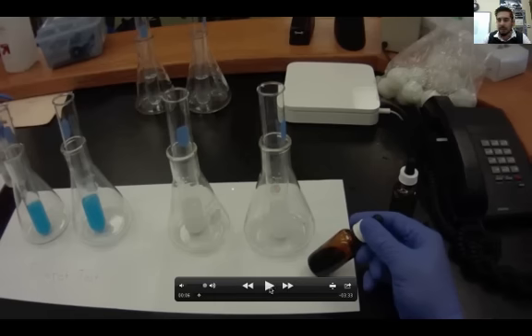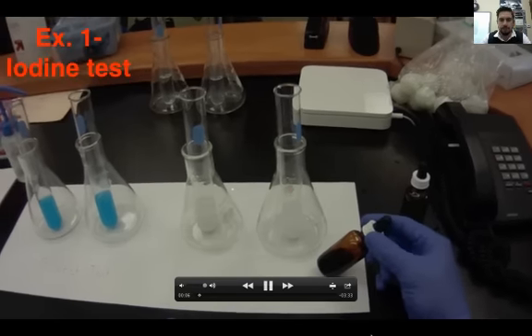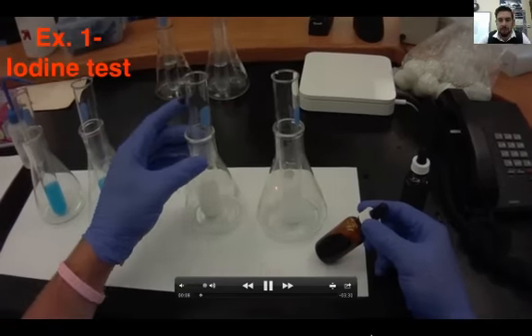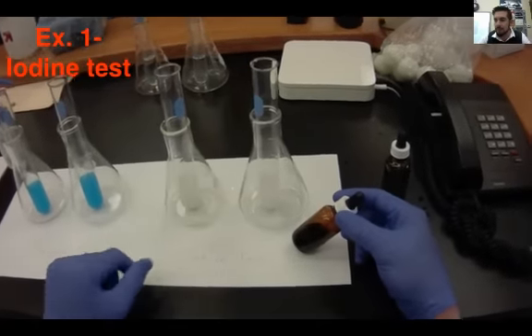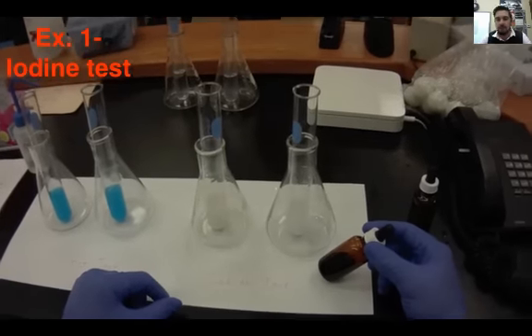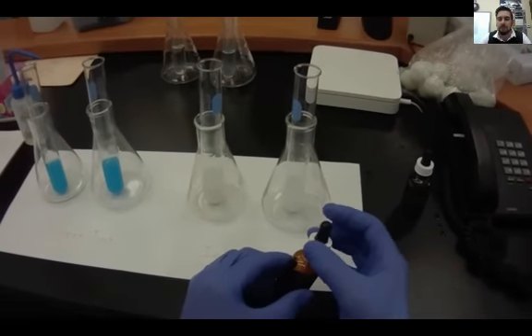You can see right here that I have my iodine ready to go. In these two tubes I have an unknown sample of either a polysaccharide or a monosaccharide or a protein. Well, the iodine test tests for polysaccharides, so long chains of molecules.